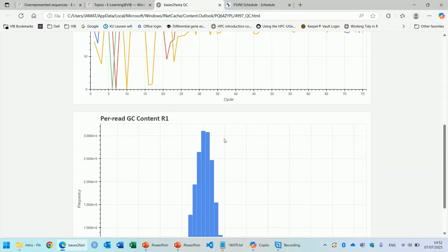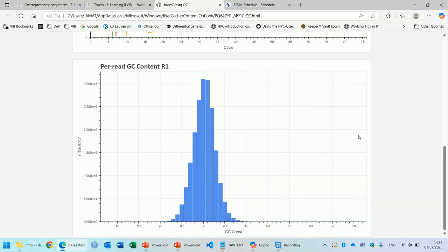When you scroll down here, you end up with this plot. This is also an important one. It's closely related to the previous plot, and it shows the distribution of the GC content across the reads. For each read, the GC content is calculated, and then we build a histogram of all the GC contents of all the reads, and that's what you see here.